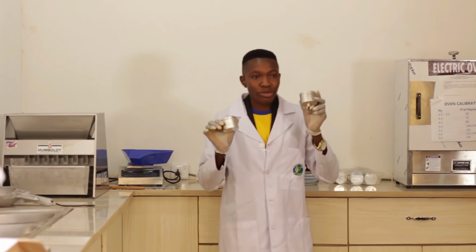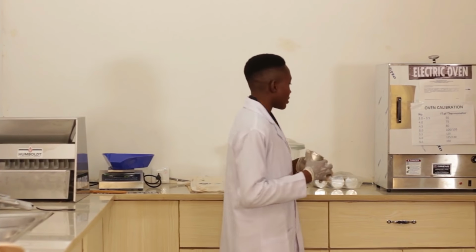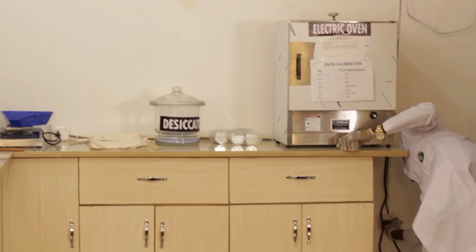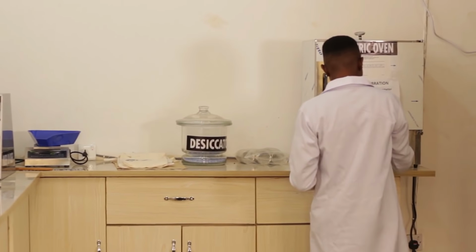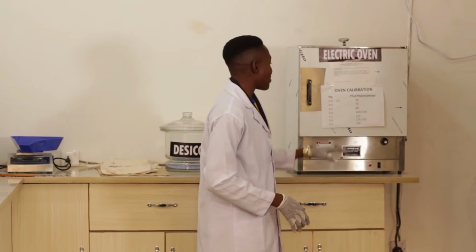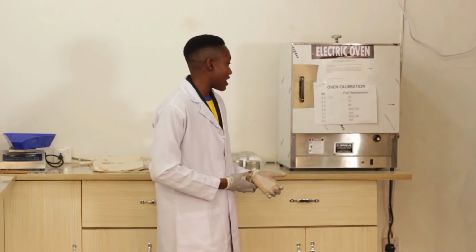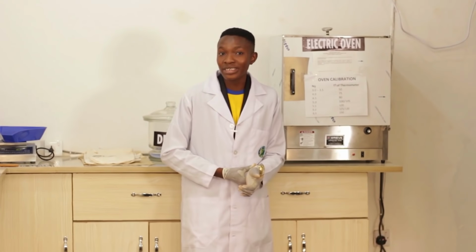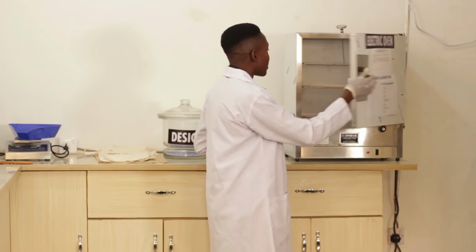Replicates. Measure one sample, 5 grams in each of these cans. Then you turn on the oven and allow it to calibrate. When you turn it on, we conduct our moisture test at a temperature of 130 degrees C. After weighing your samples, you put them into the oven.